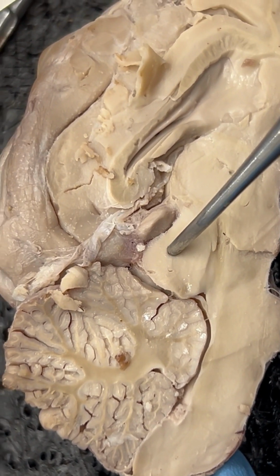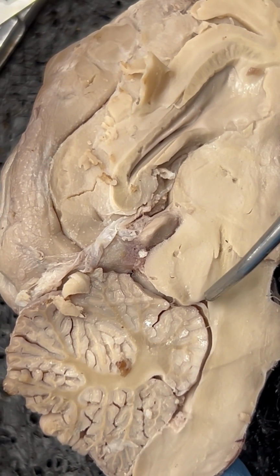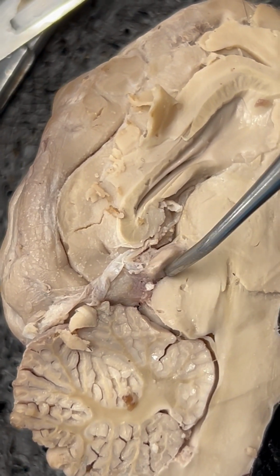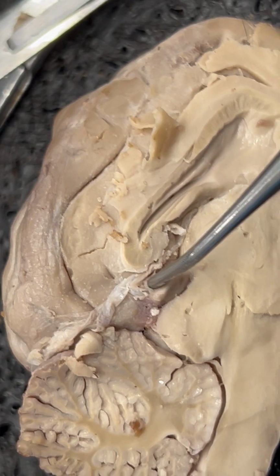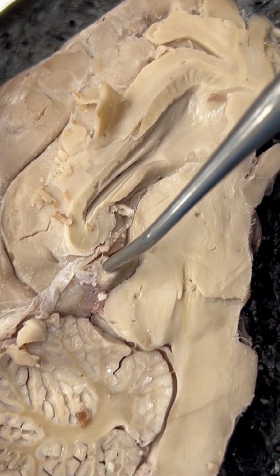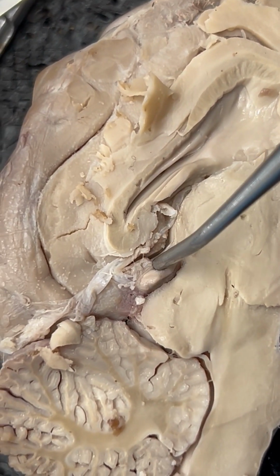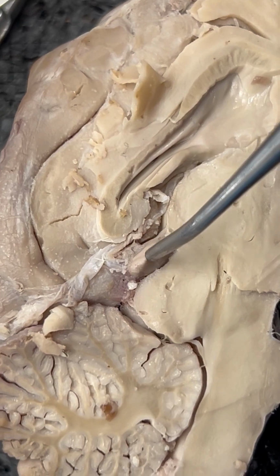So superior colliculus, inferior colliculus. Number 6, we have the pineal body, which ended up all on this side for me. So on my other half, I can't see the pineal body, but we can see that here's the pineal body. It looks like a pretty distinctive protrusion of a structure.